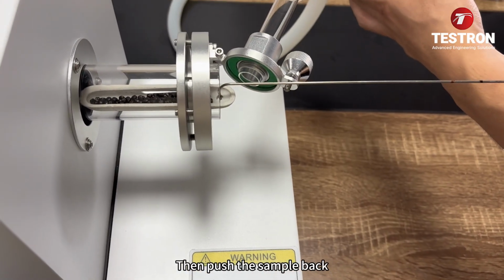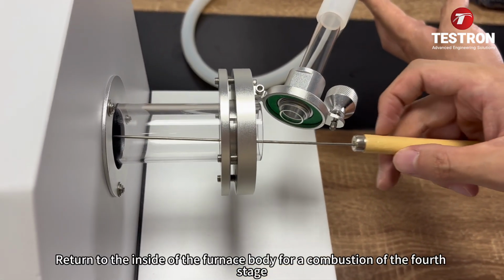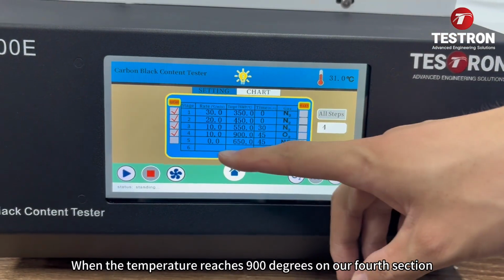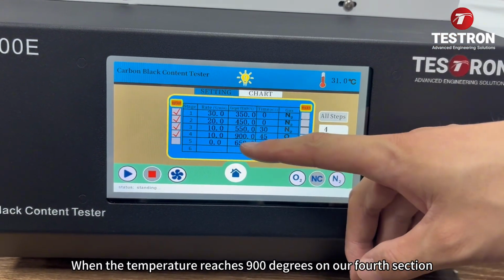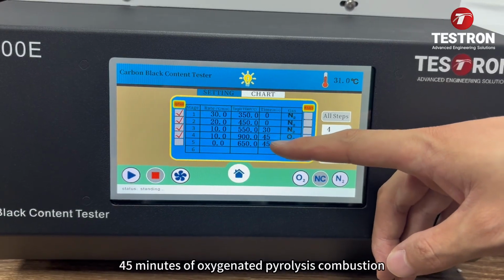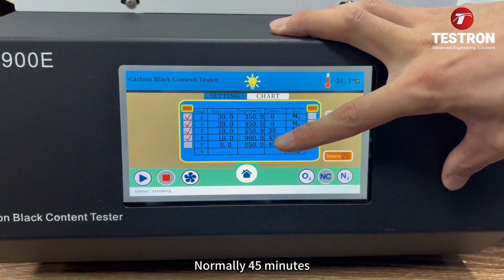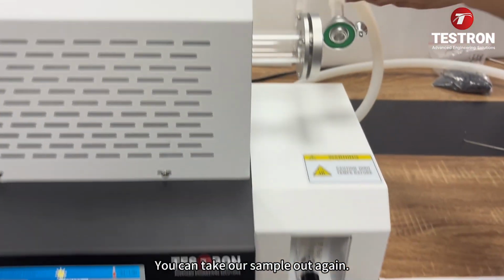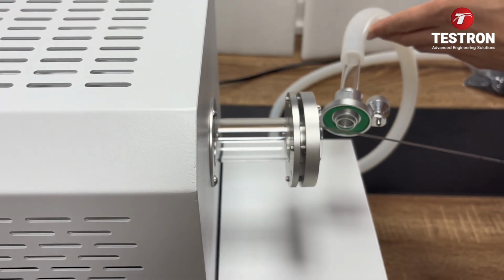Then push the sample back to the inside of the furnace body for the combustion of the fourth stage. When the temperature reaches 900 degrees in our fourth section, there is 45 minutes of oxygenated pyrolysis combustion, normally 45 minutes. In about 20 minutes, you can take our sample out again.